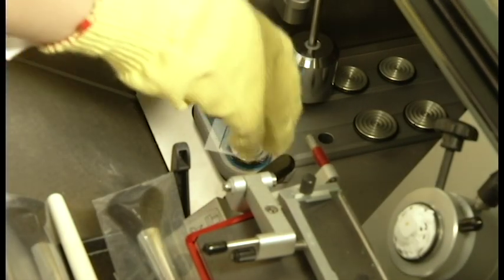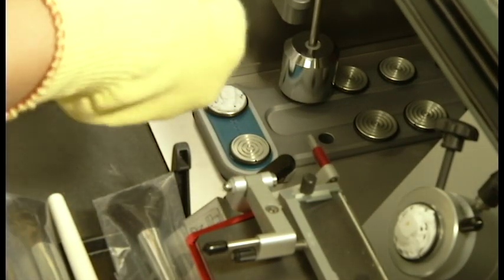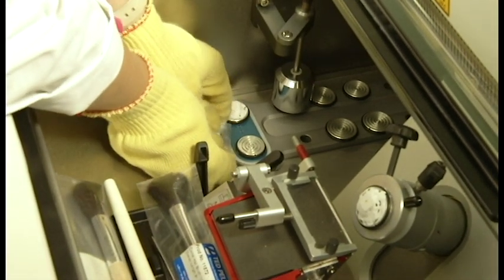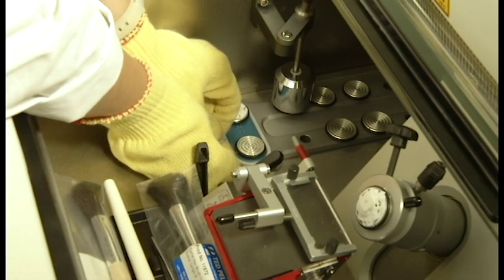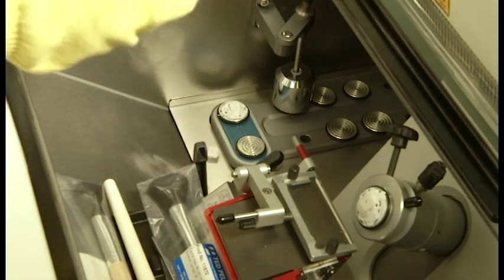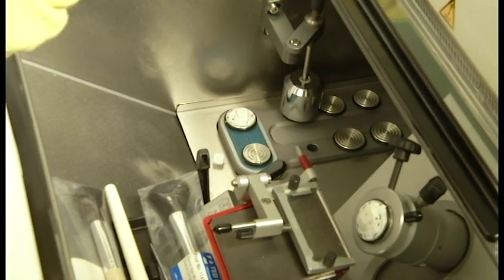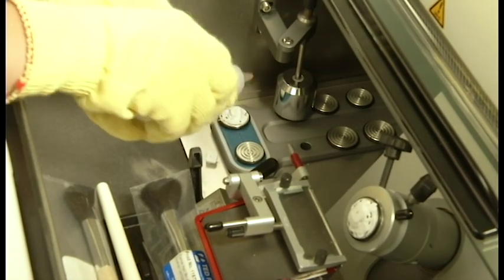You will recognize that the upright tissue block that we made in the mold needs further processing before we are able to mount it in the mounting area. You are going to force the small frozen block out of the frozen mold by applying pressure with your hands to the base of the mold so that it falls onto the floor of the cryostat area.